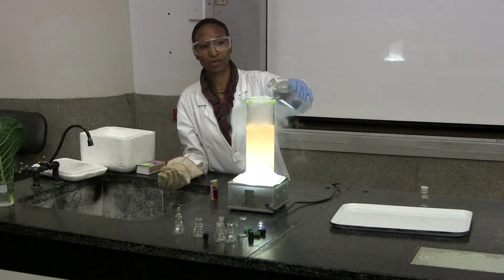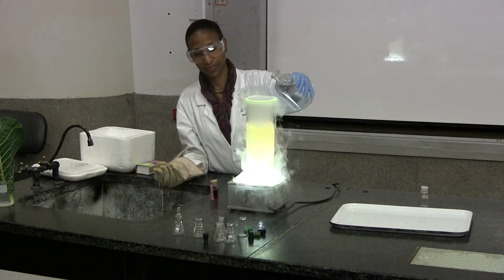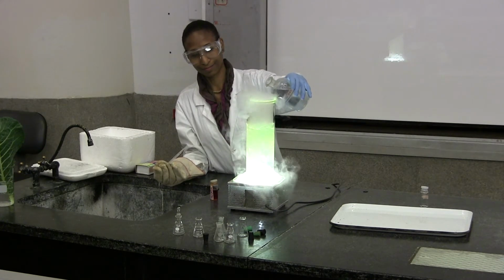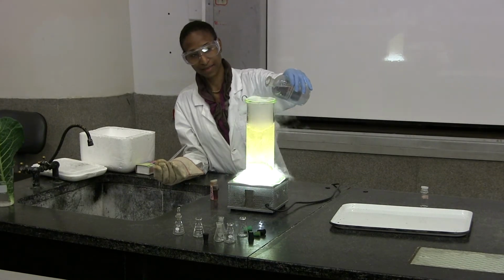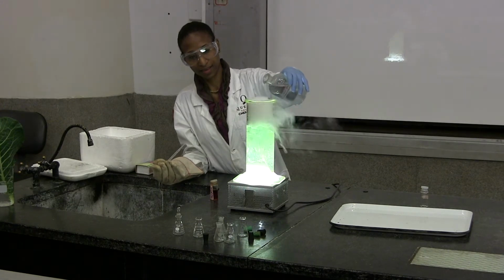I gotta be careful. Woo! Wow. It's really turning back to acid. I want to go back to my blue. I'm getting there.